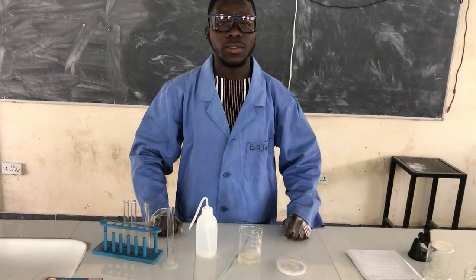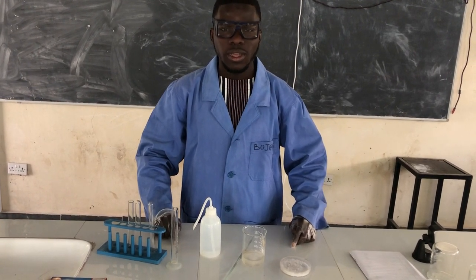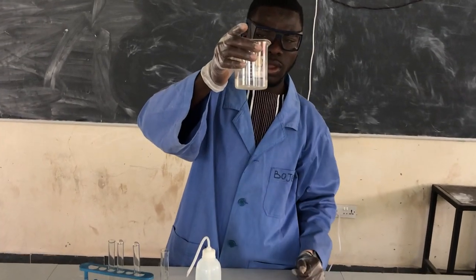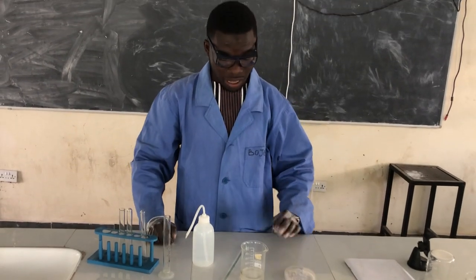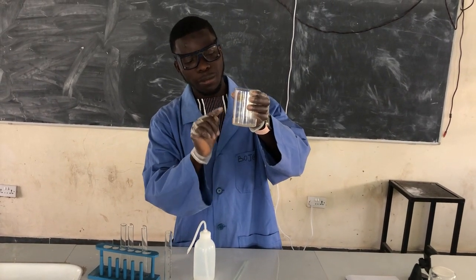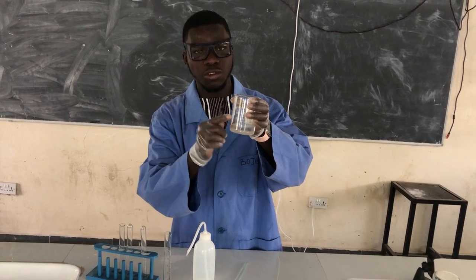Welcome to this video. In this video, I'm going to show you how temperature and volume affect solubility. Now here, we have our saturated solution. We are going to see how volume is going to affect this solubility, whether this salt is going to dissolve. Remember, at this given volume and this temperature, the solute cannot dissolve because it is saturated.